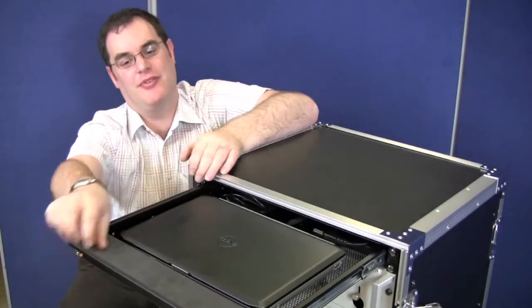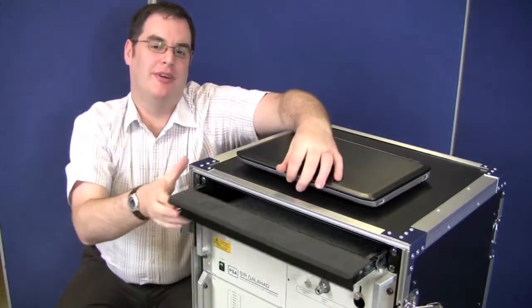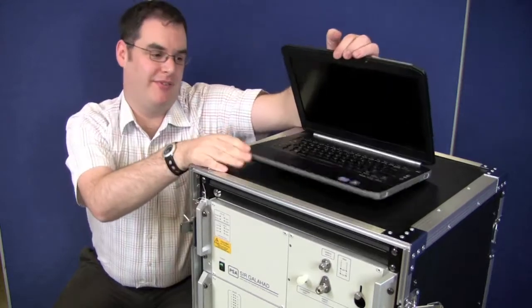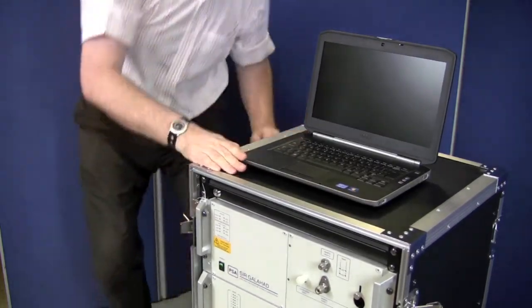Laptop stored in a lockable drawer at the top of the instrument, take it out, put it onto the top and plug in the cables that are conveniently positioned at the back of the instrument.